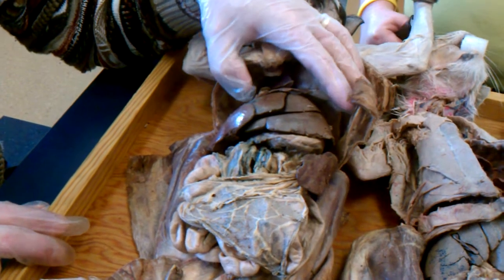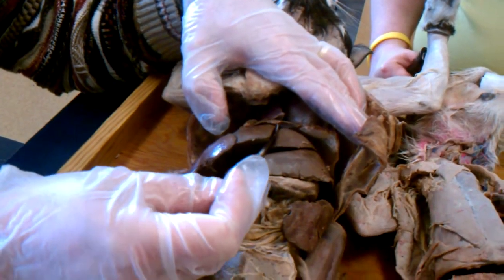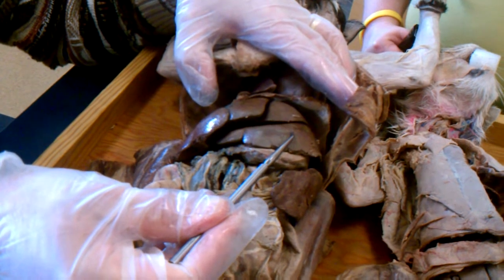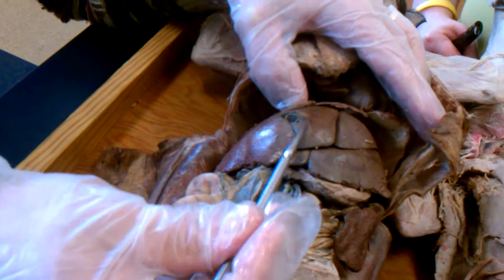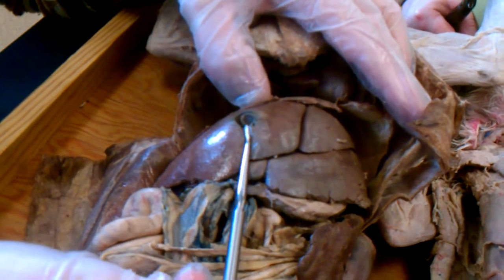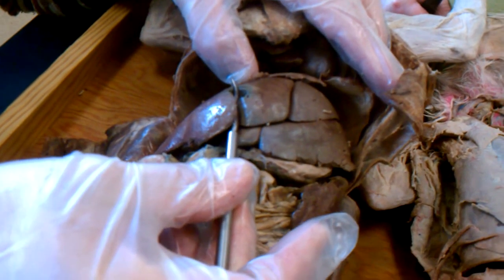Organs of the cat. Here, just below the diaphragm, we see the liver, divided down the center by a midventral indentation. This is the left lobe of the liver: left lateral lobe, left medial lobe. Right medial lobe is large and has the gallbladder in the center, which is something that throws people off because there's an indentation that looks like it should be dividing that portion of the liver into subparts, but does not.